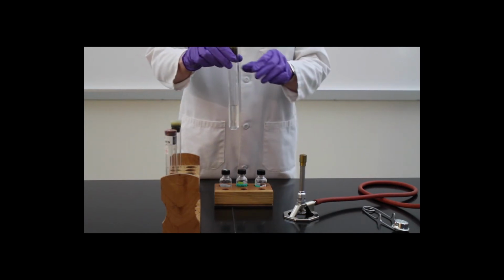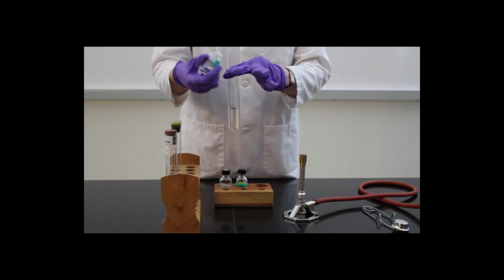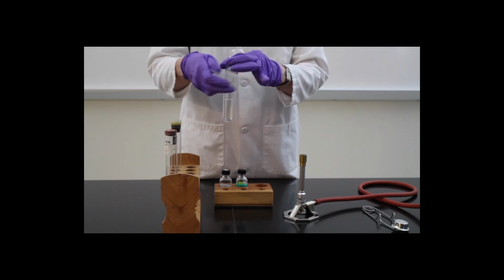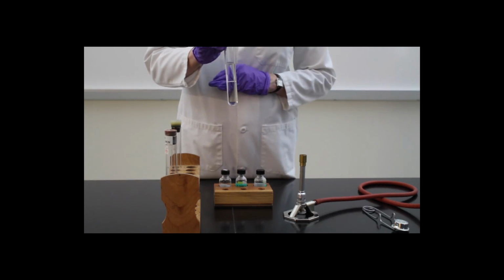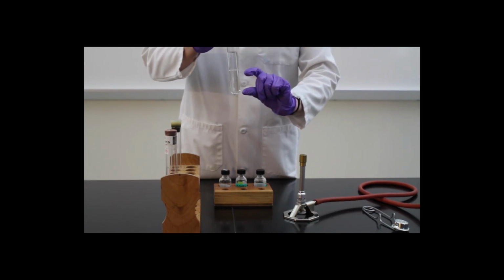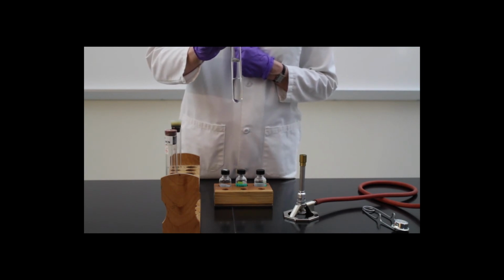We're going to go back to the test tube containing water and iodine, and we're going to add hexane to this test tube. And what you will notice is that there are two layers to this solution. There is the top layer, which is the hexane, and the bottom water layer. This implies that these are not mixing together, and that is due to differences in polarity. Again, the hexane is nonpolar and the water is polar.